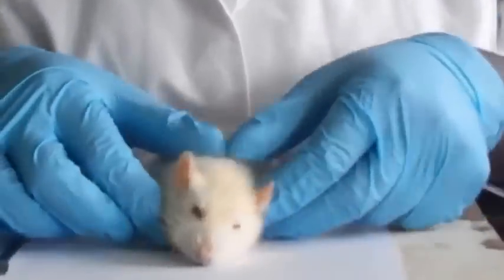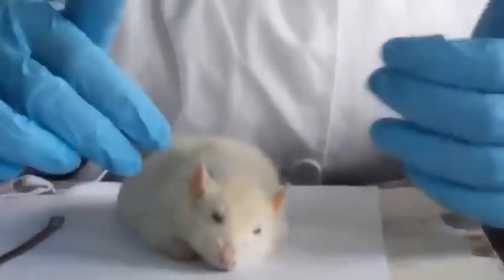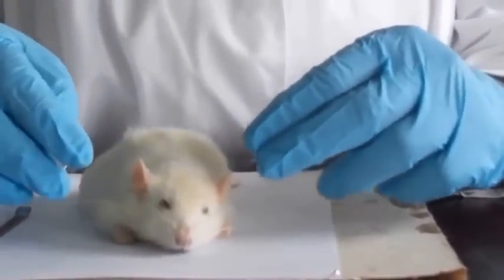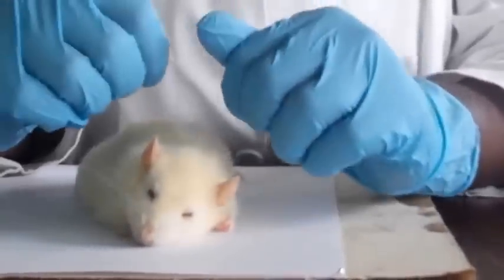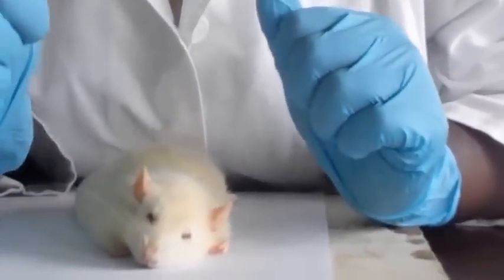And then we have the neck, and you can see that the neck is really thick and loose. This is because there's a lot of fur in this place, and in case of a predator, it does not easily kill the animal since there's a lot of thick fur here, so it's not easily killed in the process of hunting it down.